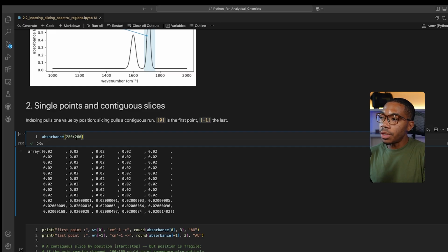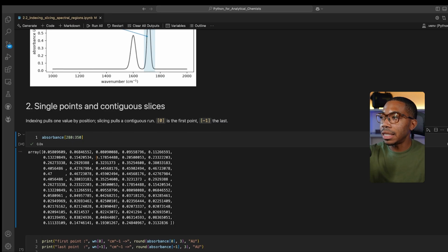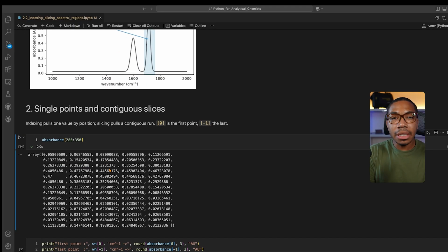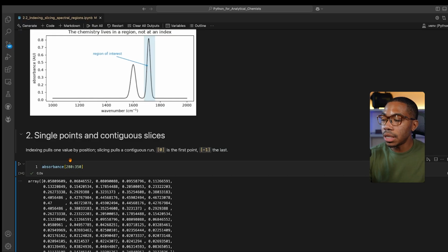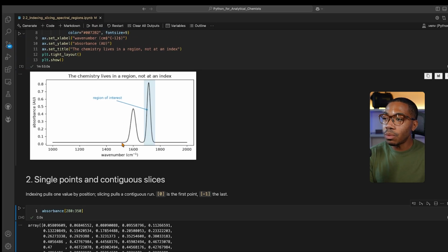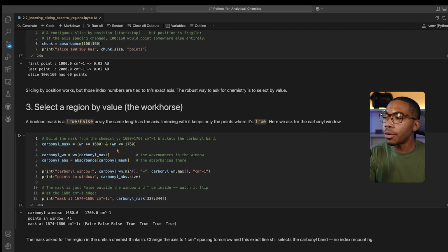And I really want to show the challenge we have when we are looking at data in this way. Where, okay, now we're in a range where we're starting to see our intensity values increase, our absorbance values increase, but this is not a very optimal way to try to select any region based on the Python-based indexing. We're just slicing through this array using this index-based location. It's much better to try to slice the data using the chemistry axes. So thinking about how we define these peaks, we don't define them based on their array location. We define them based on the wavenumber range by which you want to slice. So let's go through and actually select the region by value. This is where it really matters.